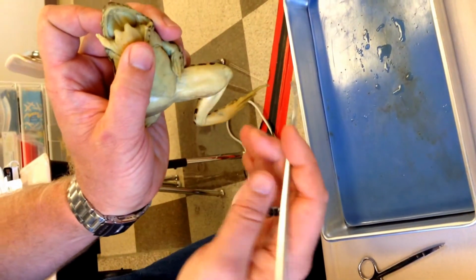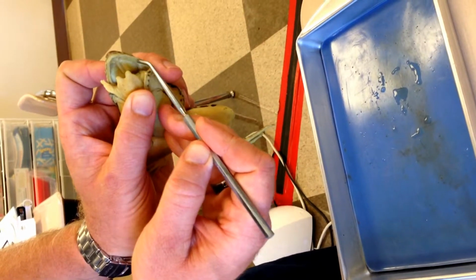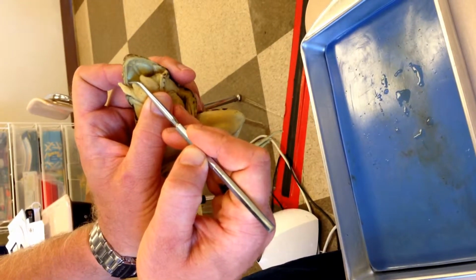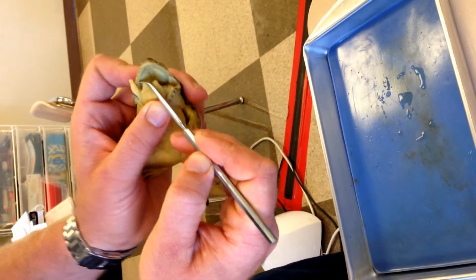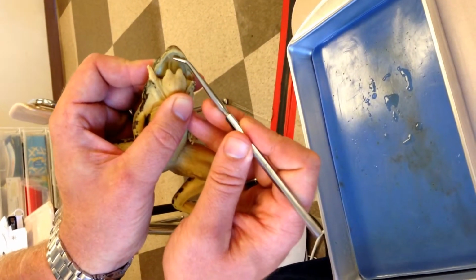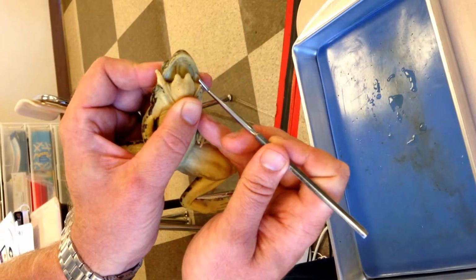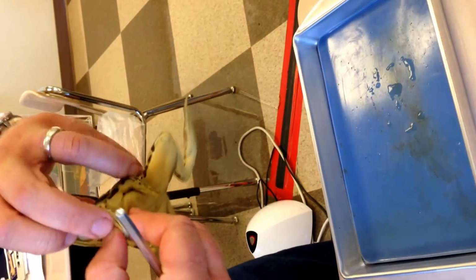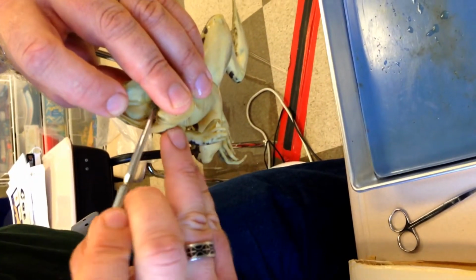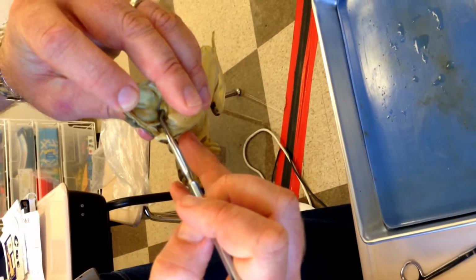Number five, there are two kinds of teeth. Number five is the kind of teeth that are found in a row around the outside of the mouth. Number six are these little bumpy teeth right here. There's only two of them, and they're kind of at the roof of the mouth. Number six. Number seven, in the back of the mouth, there is an opening to the lungs. Right there. Goes down to the lungs. Number seven.